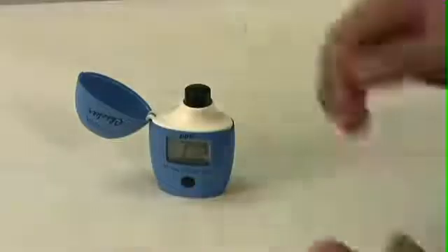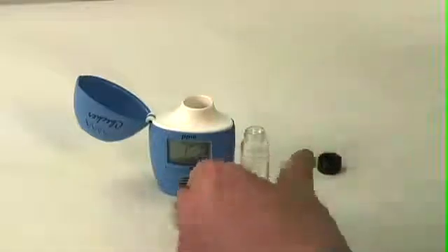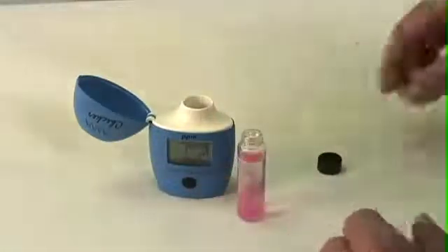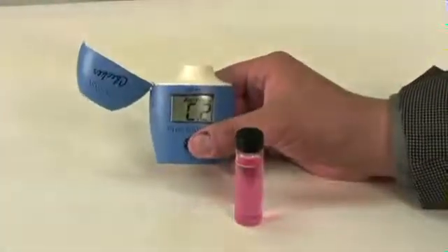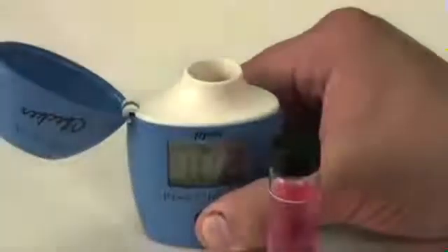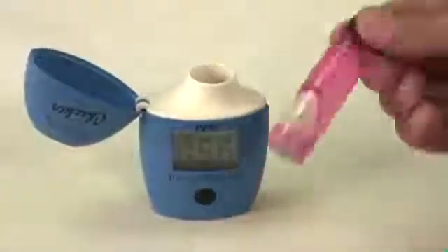Now having opened the meter, we remove our cuvette and add in our DPD reagent. One of the most interesting features of the Checker is that we actually have a timer, which you access by pressing and holding the button for three seconds. This timer begins a countdown for the reaction with our free chlorine.